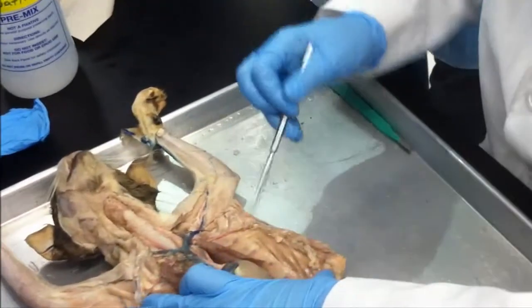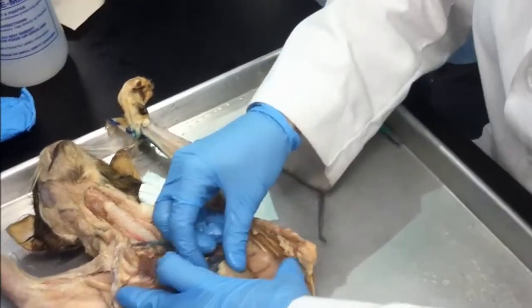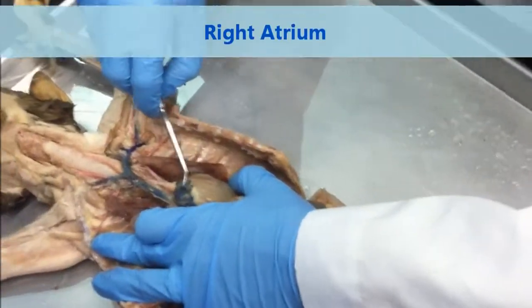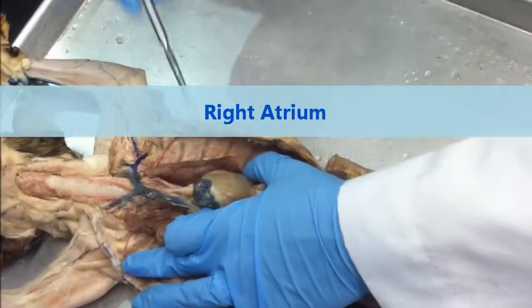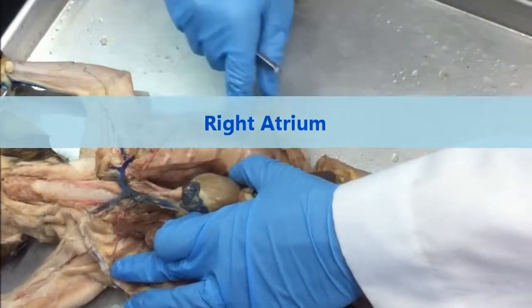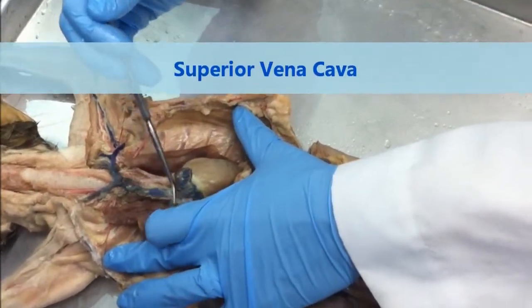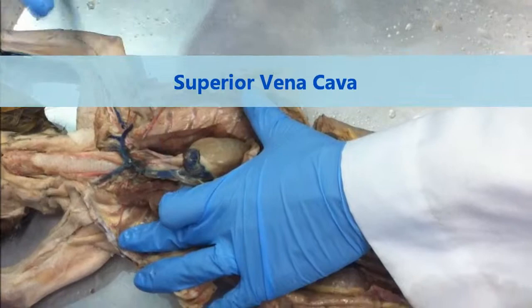Where do we start? We want to start at the heart? Okay, we'll start at the heart and go up from our, what is this? Right atrium. You're going to need to identify this chamber in the heart of the cat, not dissected, just like this. From the right atrium, we come up to the superior vena cava.